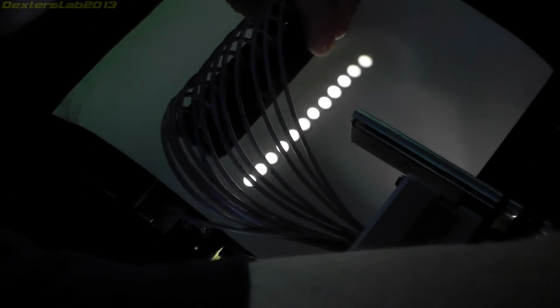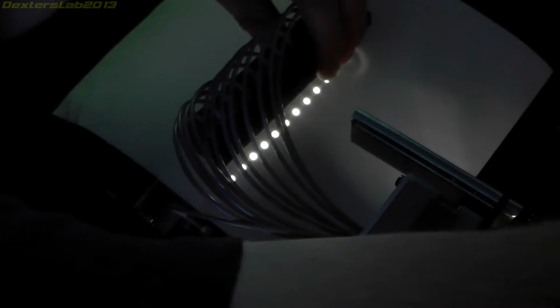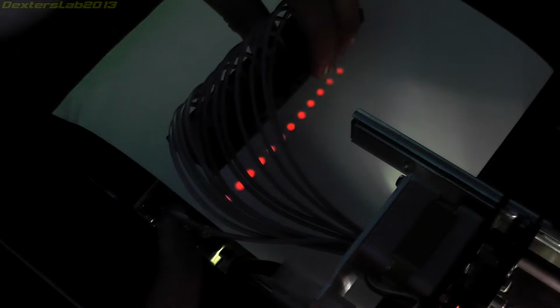So right, what I've just done, I've turned out the lights, and I've got the light connected to my bench power supply. So I'm just going to run through the different filter wheels on this and project the light onto a piece of paper, and presumably we should be able to see the colours. So there you can see that looks white. If I rotate the colour wheel around, not much difference on that one. That one looks pretty much the same. Obviously there might be very subtle differences between these. Oh, that one's clearly red.